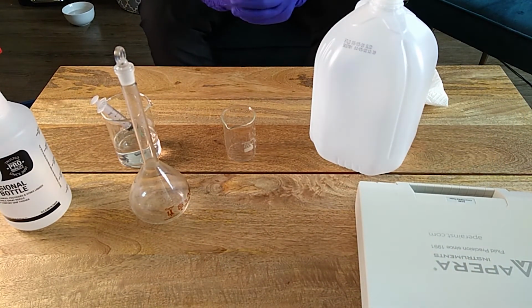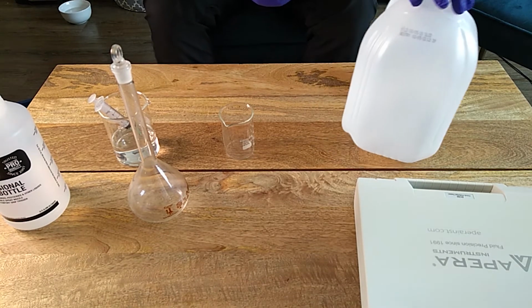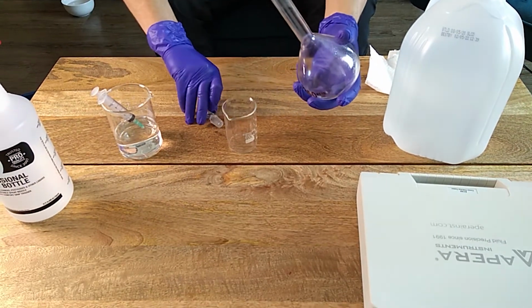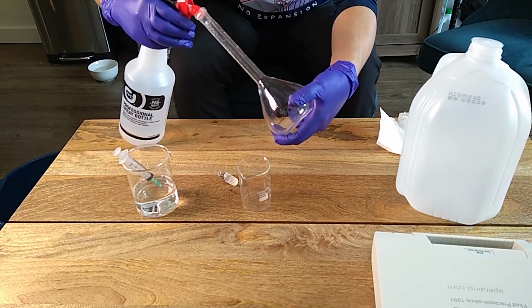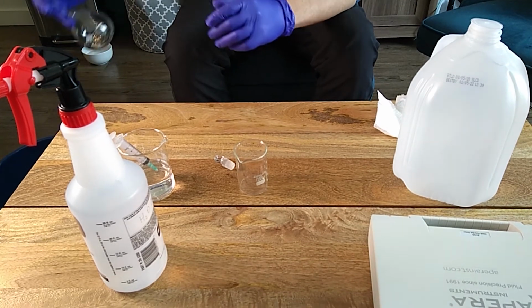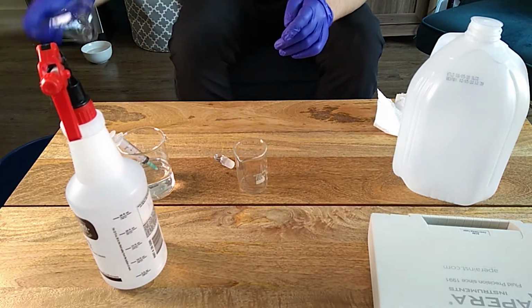I don't like mixed pH EC meters because I like all my probes to be separate, because that's how chemists are. First of all, we're going to purge this because we want to make sure that there's nothing in here. That's always a good first step. A flask with distilled water is always a great thing to have. I always purge 3 times with distilled water, which is for good luck. You just swirl it.